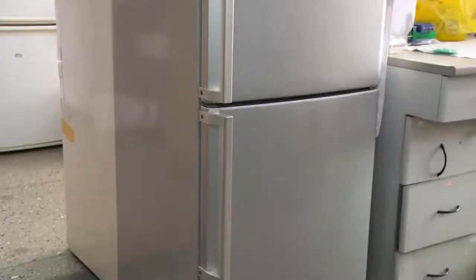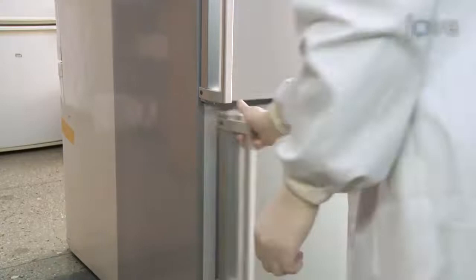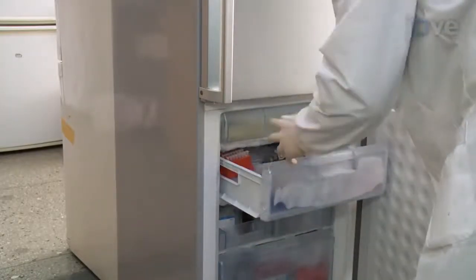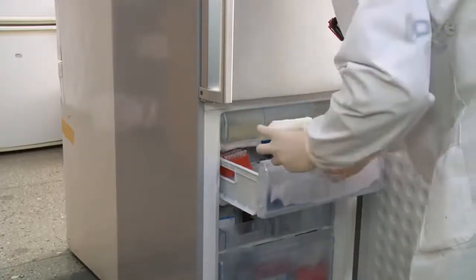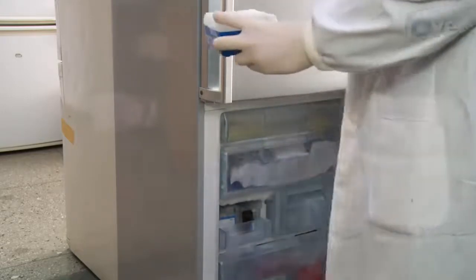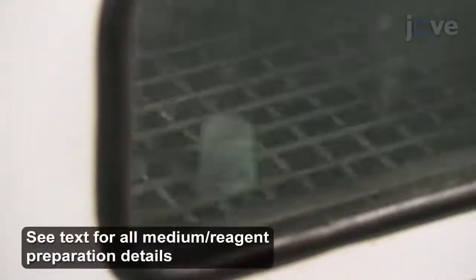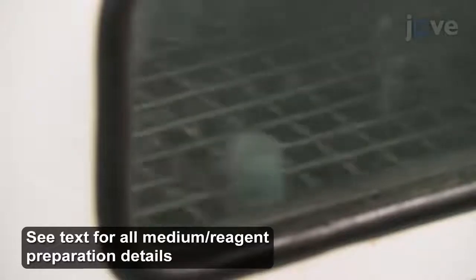To generate a biofilm in a 96-well plate, first inoculate one minus 80 degrees Celsius thawed Staphylococcus aureus USA 300 and three biofilm-forming clinical strain cultures in individual 14-milliliter round-bottom tubes containing 5 milliliters of tryptone soya broth, or TSB medium, in a 37 degrees Celsius incubator with shaking overnight.